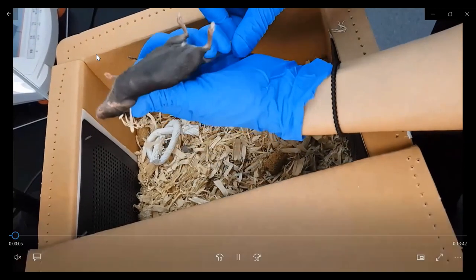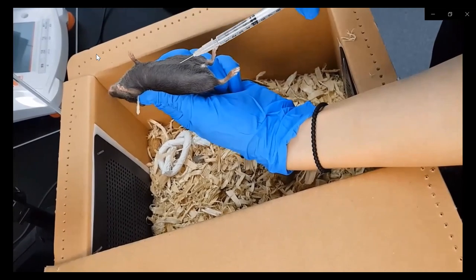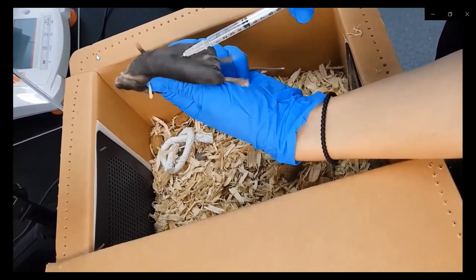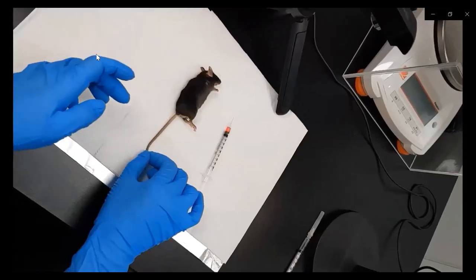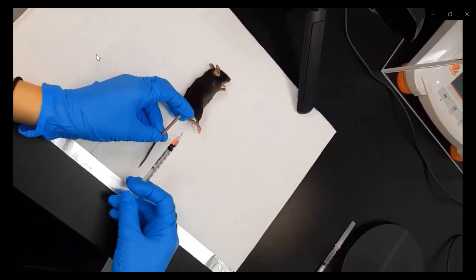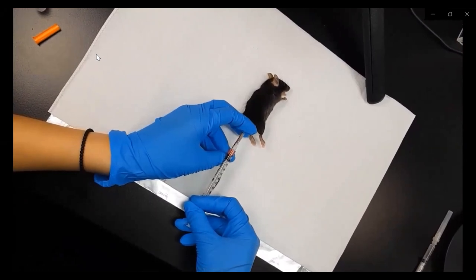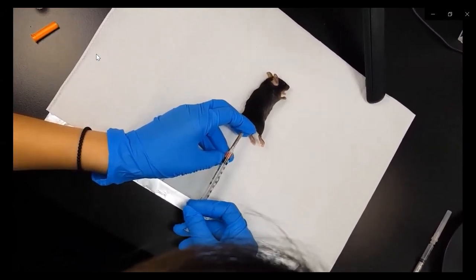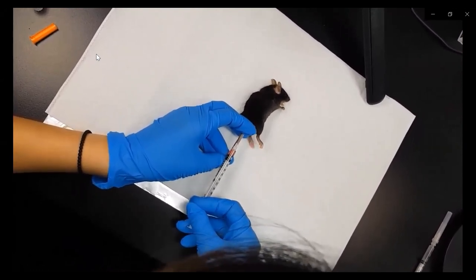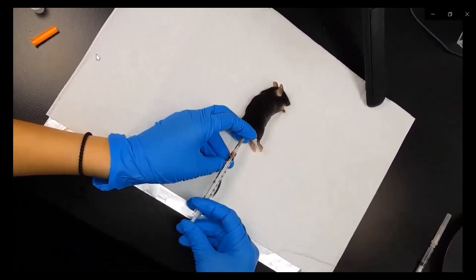Thank you for the introduction. Hi everyone, I'm Selina from IVIM Technology. Here I'll talk about the experimental procedures of intravital imaging of various organs using the IVIM system. Let me introduce how to do in vivo imaging of ear skin. The mouse was anesthetized by IP injection of ketamine and xylazine before imaging. Blood vessels were fluorescently labeled by intravenous injection of anti-CD31 monoclonal antibody conjugated with a fluorophore, or various fluorescent dyes such as FITC-dextran, TRITC, or rhodamine B were injected via tail vein. In this case, a TRITC dye was intravenously injected into the mouse model.